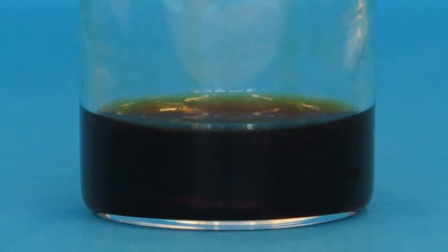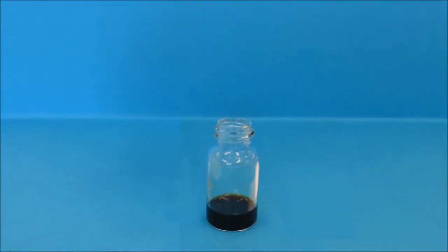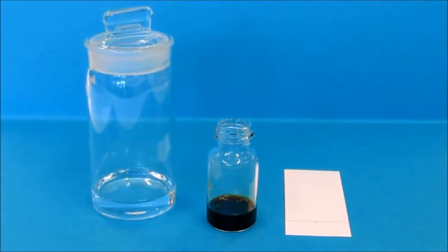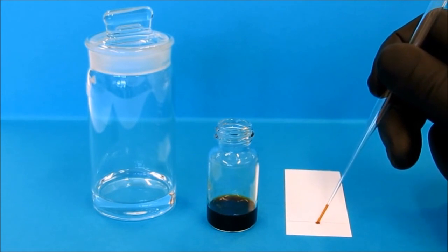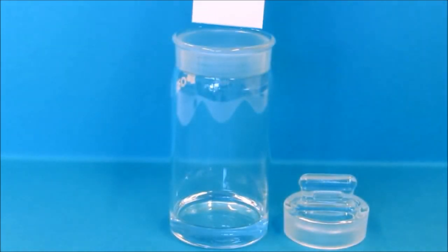Today we are talking about TLC technique for separation of mixture and for qualitative analysis. First we spot the mixture on the TLC plate at the starting line.